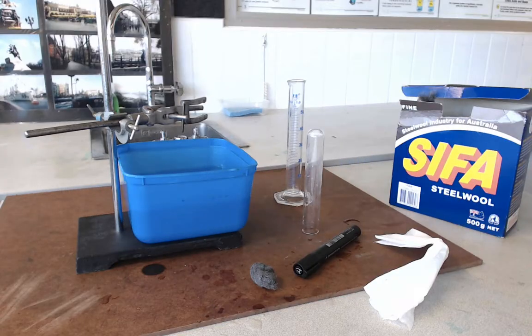Hello and welcome to this film which is all about the Combination Reactions Practical. Here's the equipment that you need for this practical — it's a very, very simple experiment to set up.